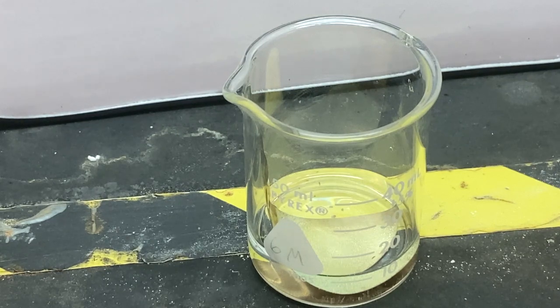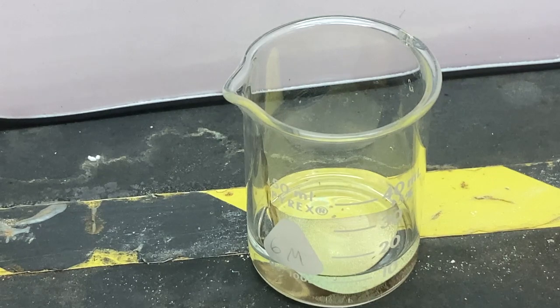As we zoom in here, you may already begin to see bubbles forming. That's hydrogen gas that's released from the reaction of the nitric acid with zinc. Another thing that you might see starting to happen is a little bit of a bluish-green tint to the water. That indicates the presence of copper ions in solution.